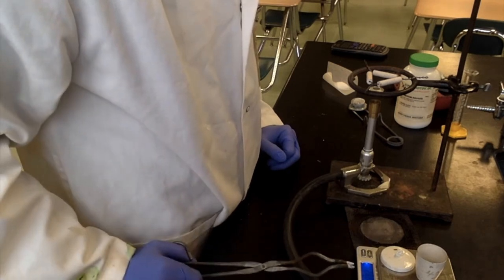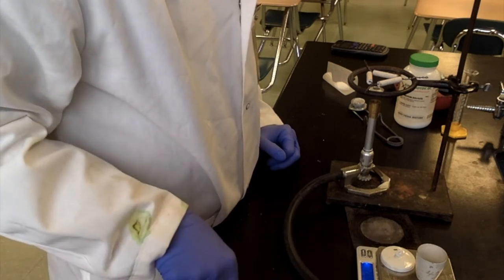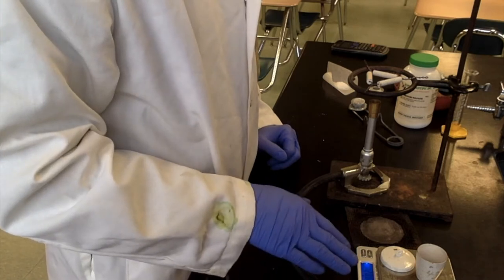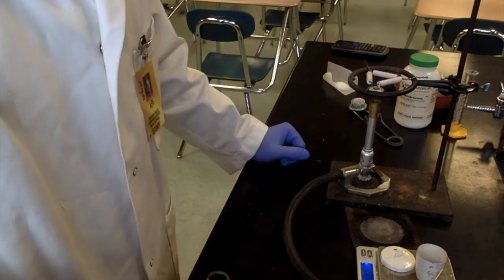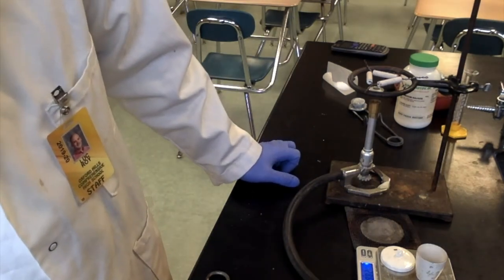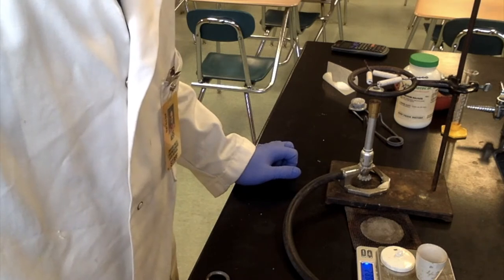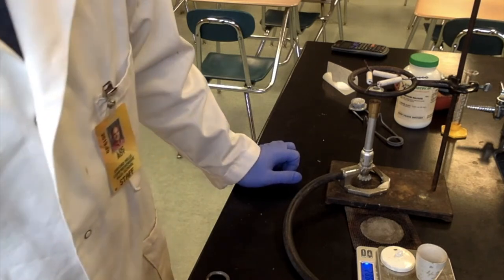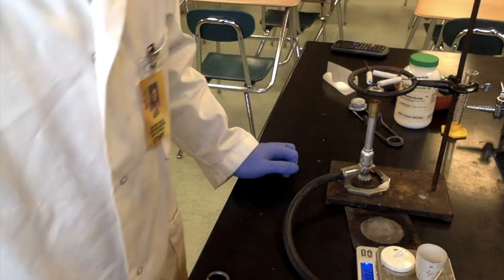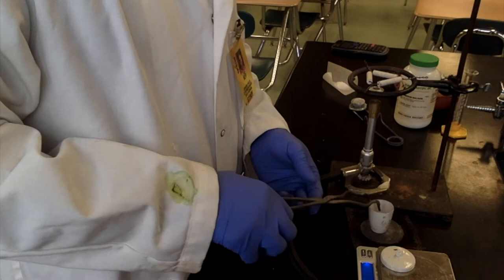The only reason we have to cool it down is it's really hard to get a weight if it's hot, as you've seen in the past. So we're at 28.65 grams. So I'm going to write that down. Let's go 28.69. It's moving around a little bit.